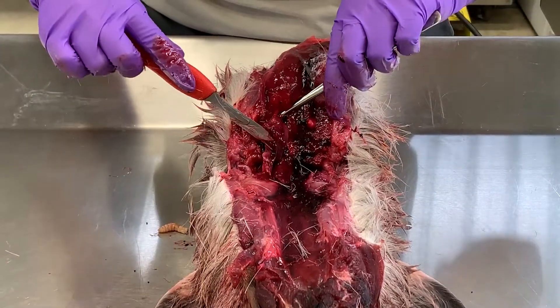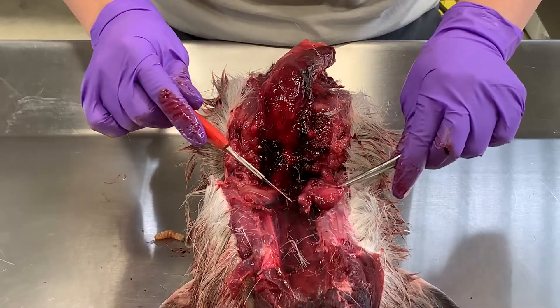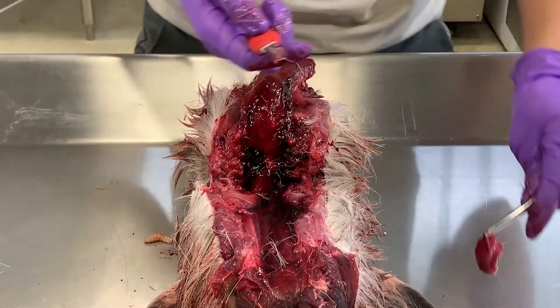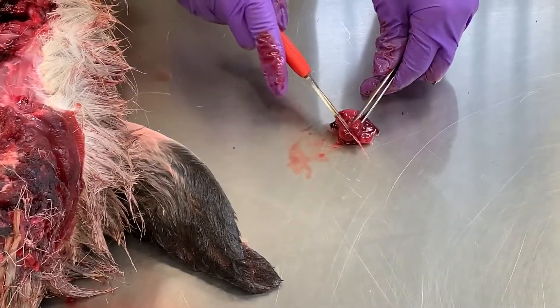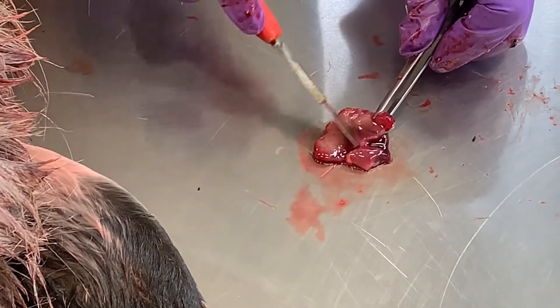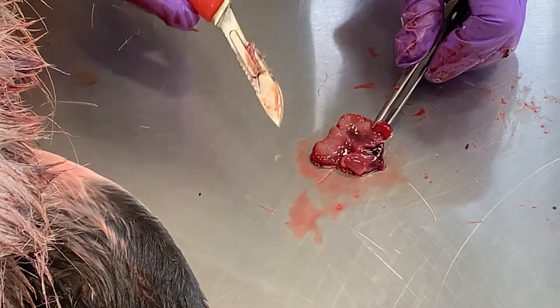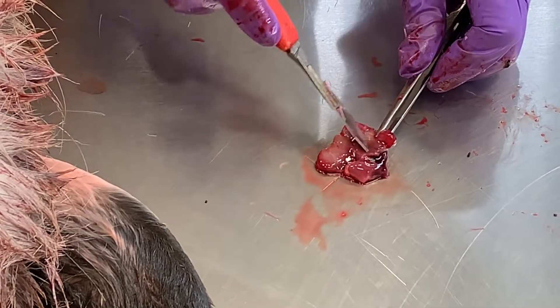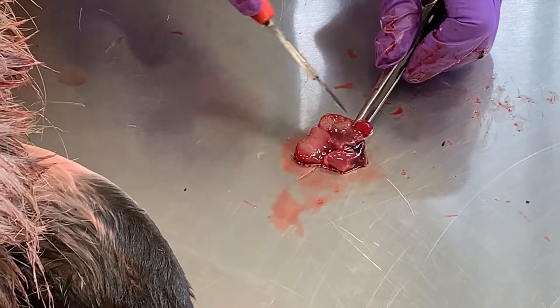I cut a little bit into it, so that's okay — I just want to make sure I get all of it. If I cut into this lymph node, it's kind of kidney-shaped and all one solid piece. It doesn't have a lot of segments like a salivary gland will. And again, it has kind of that sheen — that glossy, shiny look to it.